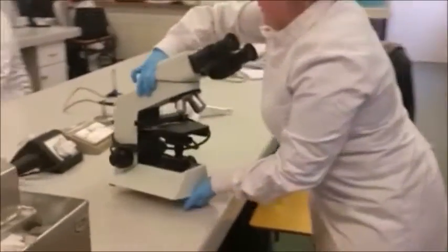When handling the microscope ensure one hand is on the bottom of the microscope and the other hand on the arm of the microscope.